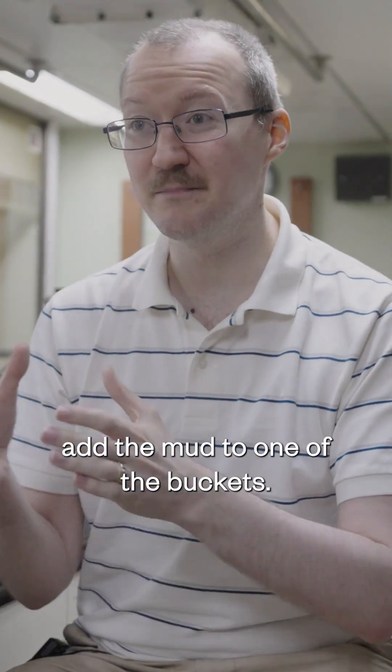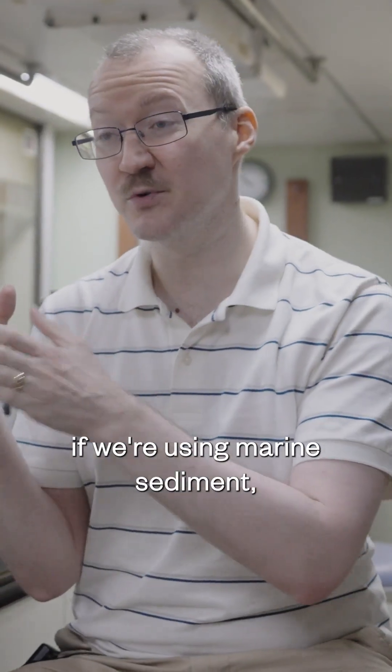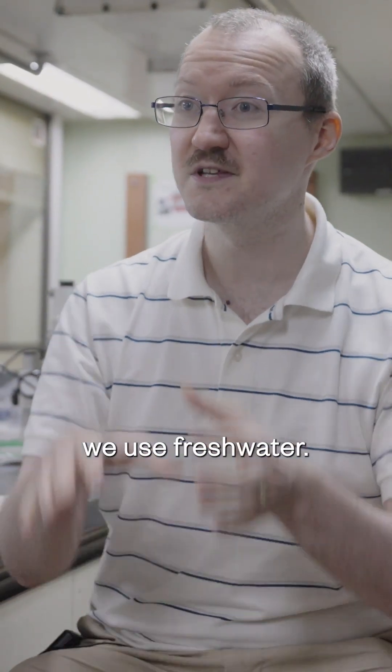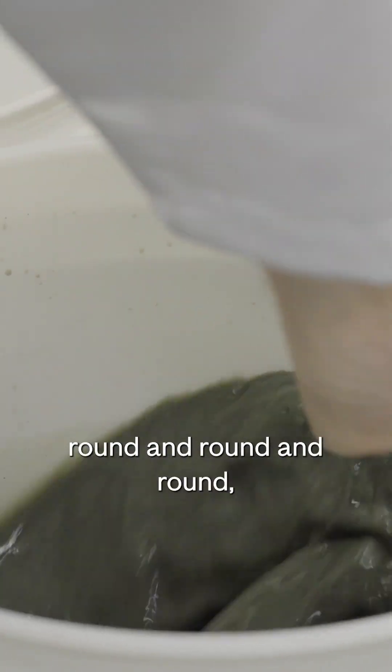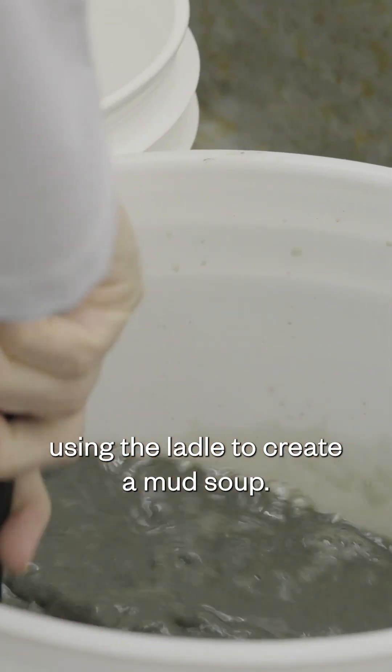First, add the mud to one of the buckets. We pour some water on it. If we're using marine sediment, we use salt water, and if we're looking at freshwater sediments, we use freshwater, then spin it round and round using the ladle to create a mud soup.